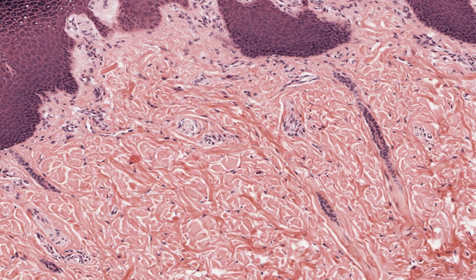Note the gaps between most of the collagen bundles. They fortuitously allow you to identify individual bundles easily, even though most of this empty space is artifactual. It formed because the collagen bundles shrink during dehydration of the tissue. In life, these gaps were small and filled with a now leaked out gel of ground substance.